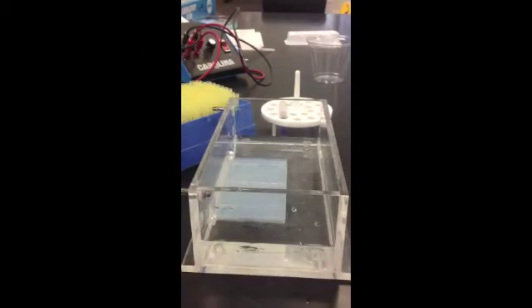Now I'm going to show you how to load a gel. So in here, this is a fake gel that we have in here. It's not real. It's for practicing pipetting for you guys. The real gel is going to be much more fragile than this one. So you need to be really, really careful with it.